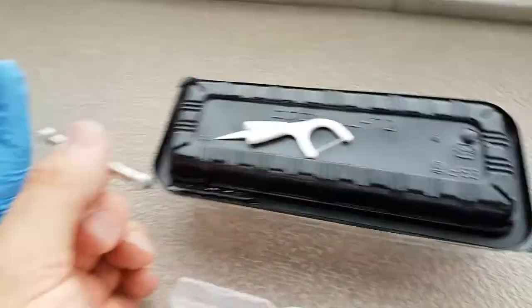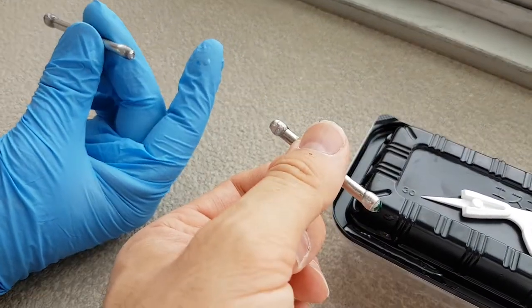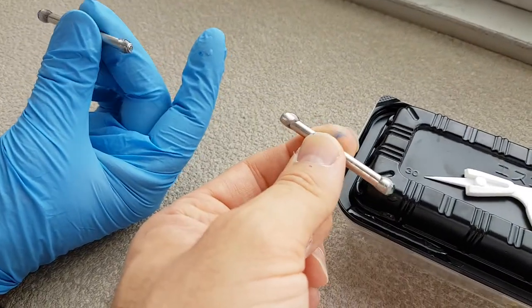We're having to roll these within our fingers to keep it nice and even on the ends. Just going to keep rolling — keep those barrels rolling.